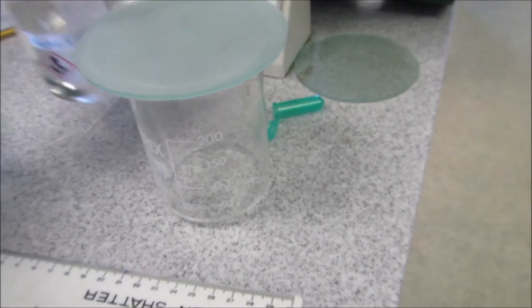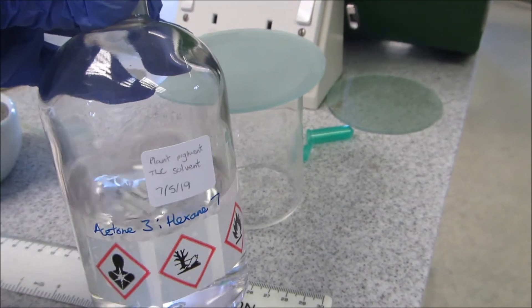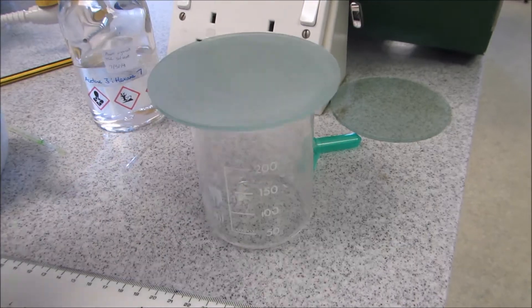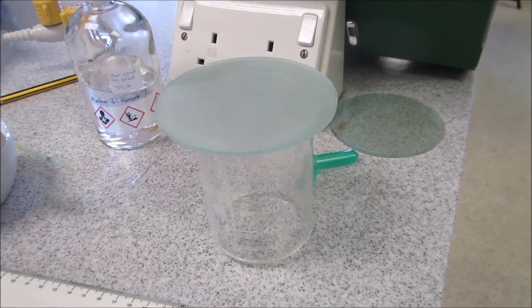But at the same time, I've also taken our solvent for this, which is acetone and hexane, and put it into a beaker and cover the lid just to allow the solvent to fully surround it.